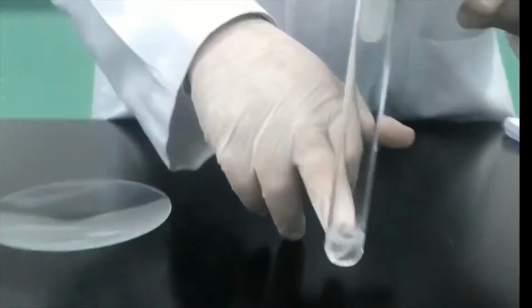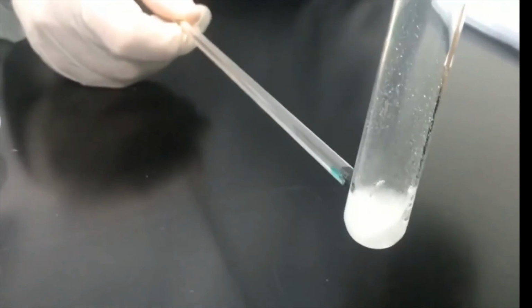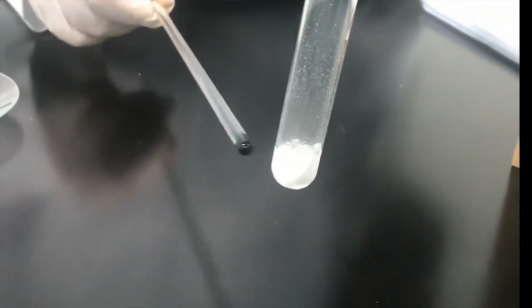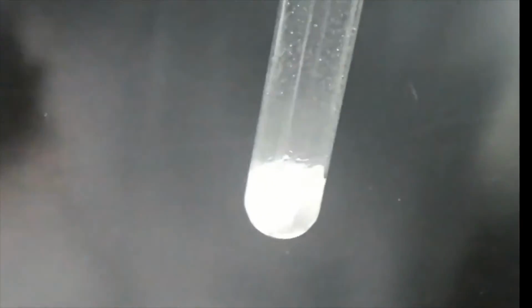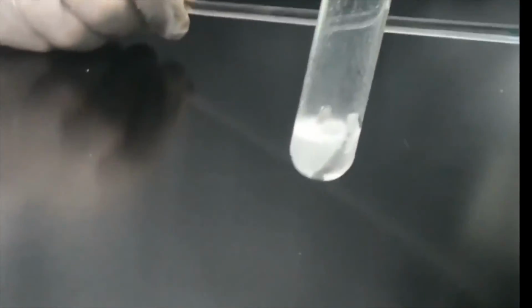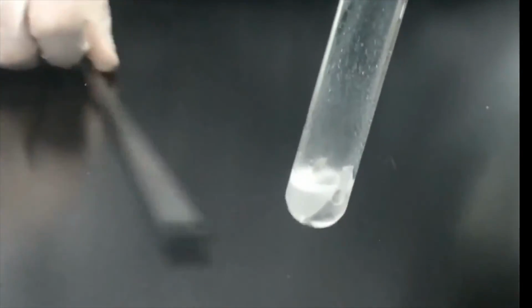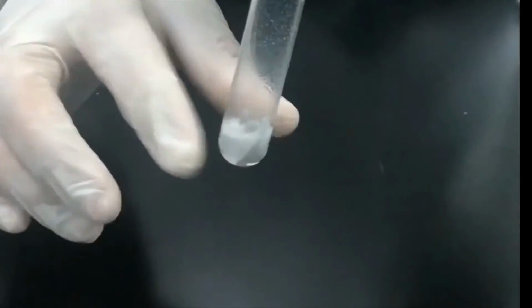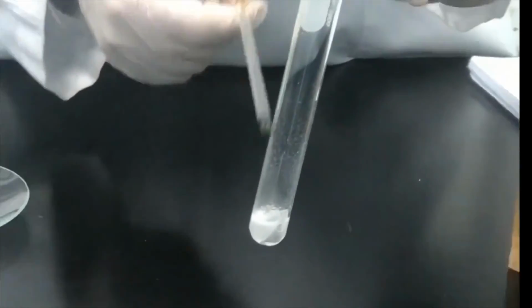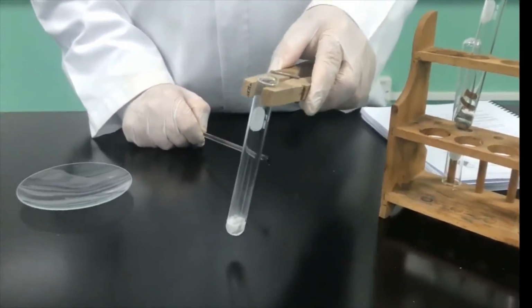As you can see here, the reaction is taking place by evolution of gas, hydrogen is coming out, and because it is hot here, we are using the test tube holder. Now, one of the evidences of this type of reaction is the evolution of heat. Although the heat is not much, I can actually hold it myself like that. I can feel the heat is already there. So we have the heat, and we have evolution of gas as evidence of chemical reaction.